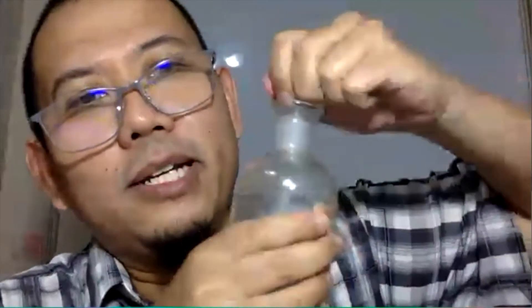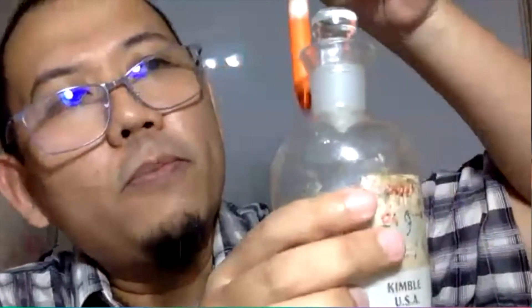This is a BOD bottle. You have to stir it — put a magnetic stirrer inside it and stir it properly. Then after 15 minutes, you have a probe. The stopper should be removable from this bottle. So, you insert the probe into the water and measure the DO for today — that will be the DO zero, the dissolved oxygen on day zero.